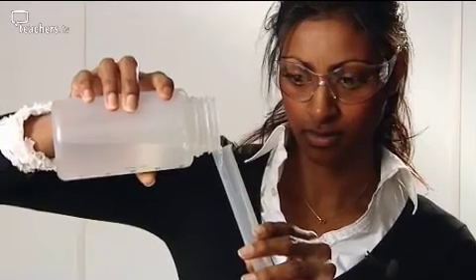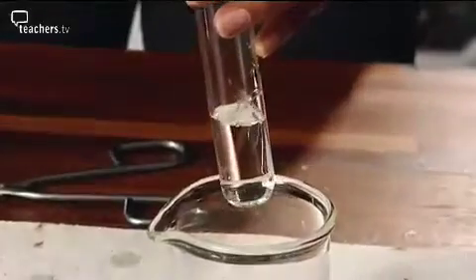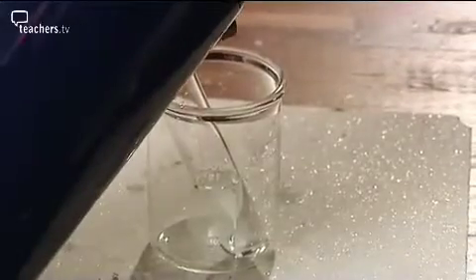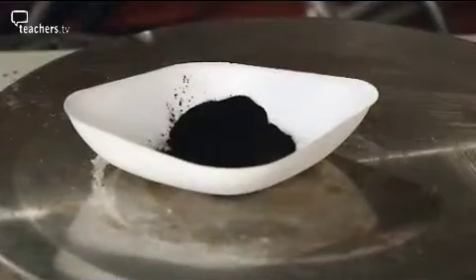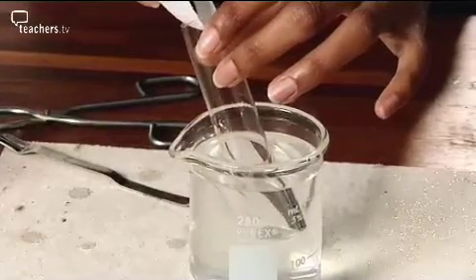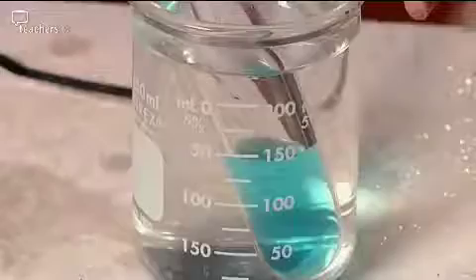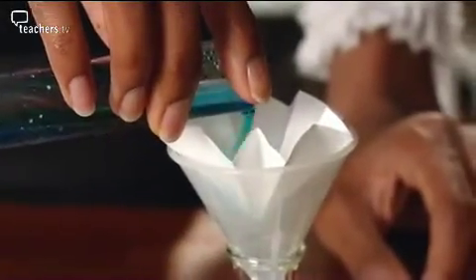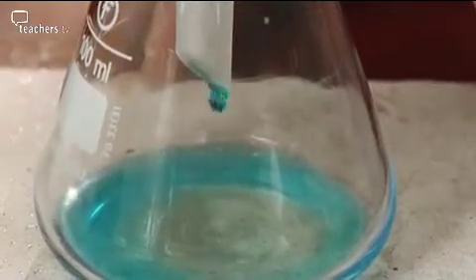Measure 15 cubic centimetres of 1.4 molar sulphuric acid and warm with boiling water. Take between 1.9 and 2 grams of copper oxide and add half to the acid. Shake until the solid has dissolved. Then add the second half and shake again. A pleated filter paper is more effective than a folded one. The solution filters much more quickly.